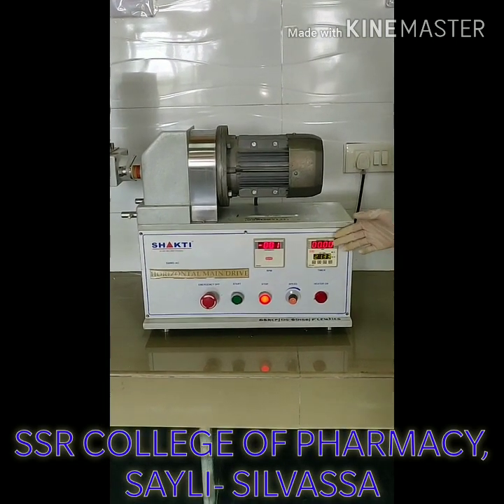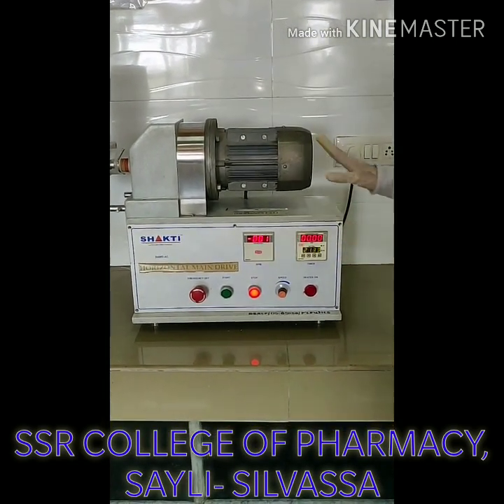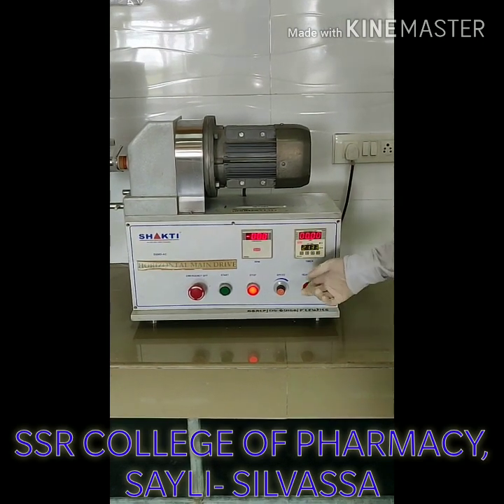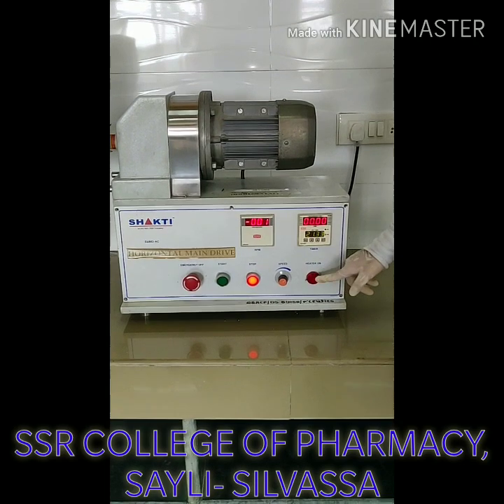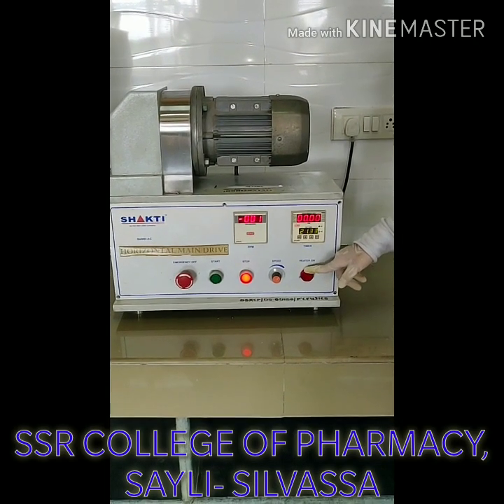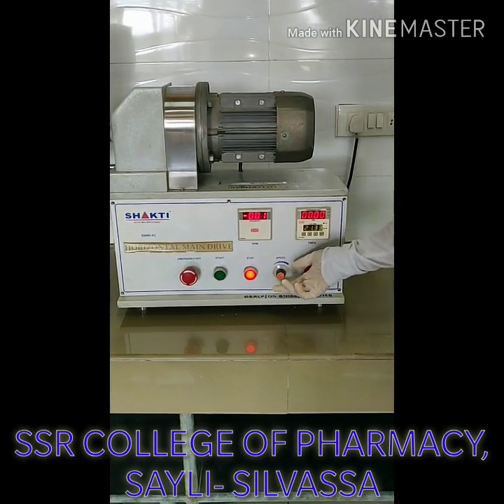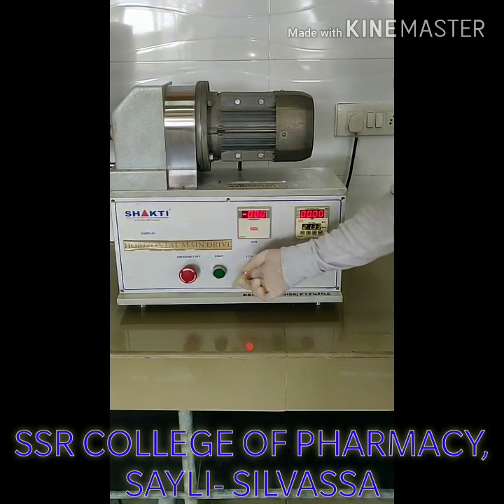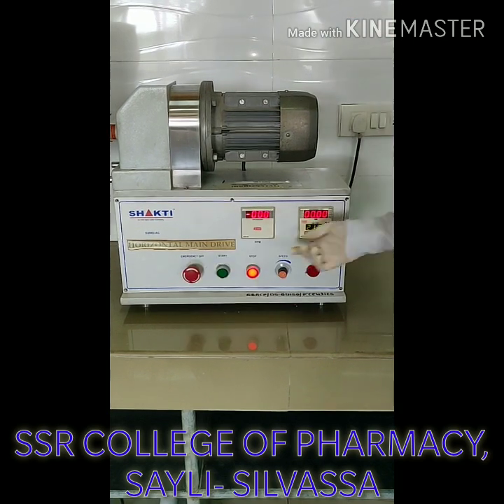Now I am going to explain you about the controls and operation of this main drive. This is the heater button — specifically we do not require it in many operations. This is the knob from where we can adjust the speed. This is the stop button, this is the start button, and this is the emergency button.